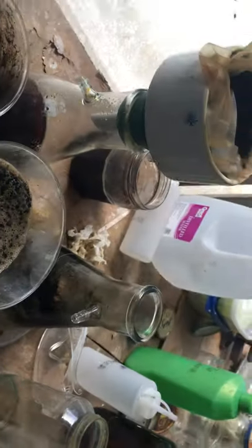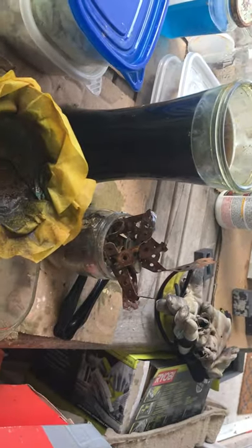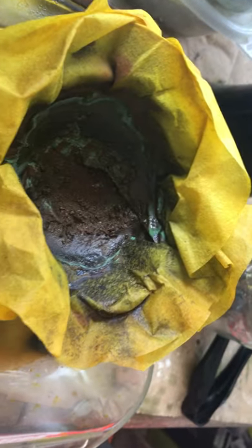From these guys, I'm accumulating this black residue. This palladium solution — the precipitated copper. This is copper, this is copper. This is whatever the first filtration I'm doing.